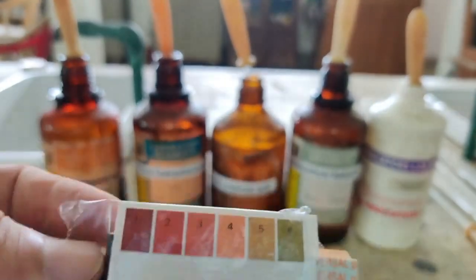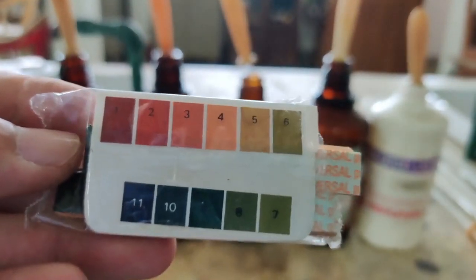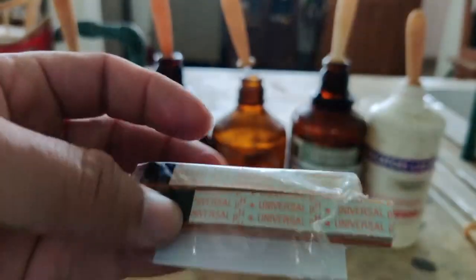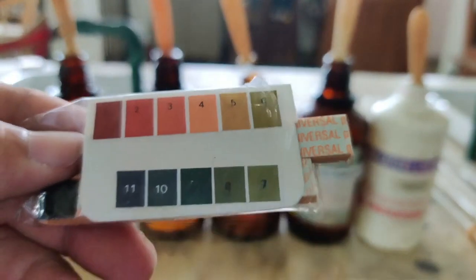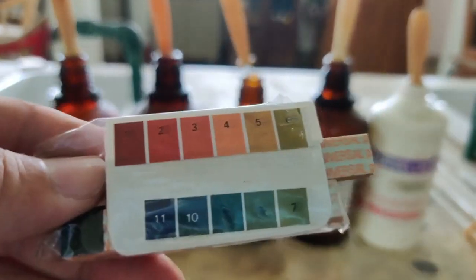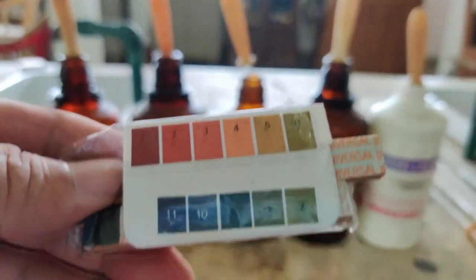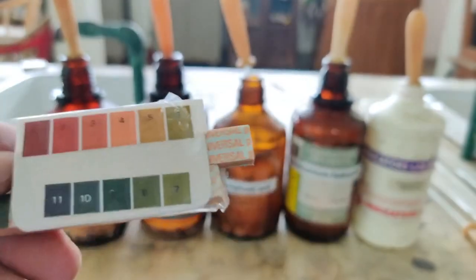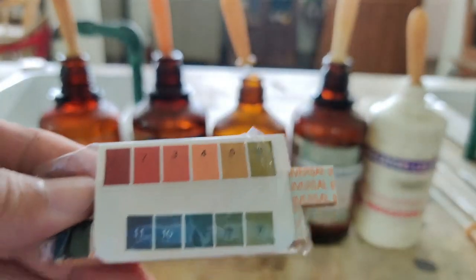This indicator will only give you pH from 1 to 11. So you can see the number 1 has a different color, 2 is a different color, 3, 4, 5, 6, 7, 8, 9, 10, 11. This color chart actually comes with the packet. We have to compare the color change with this, so that you can immediately identify the pH value, whichever color the paper has changed to. If less than 7, you know definitely it's acidic. A common indicator can tell you only whether it is acid or base. But universal indicator will tell you how acidic, because the lower the number, the more acidic it is, and the higher the number, the more basic it is.